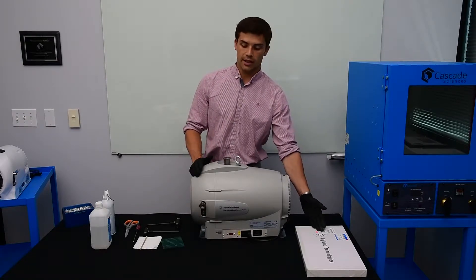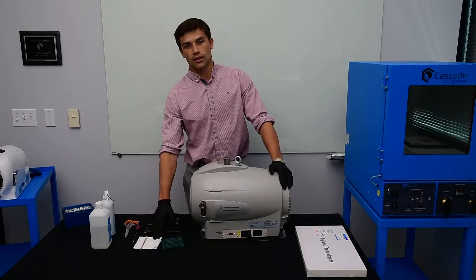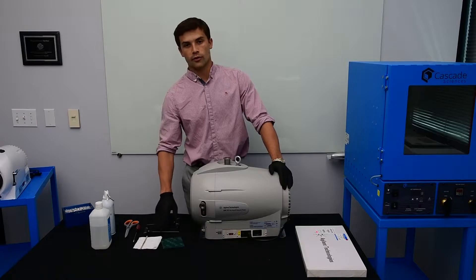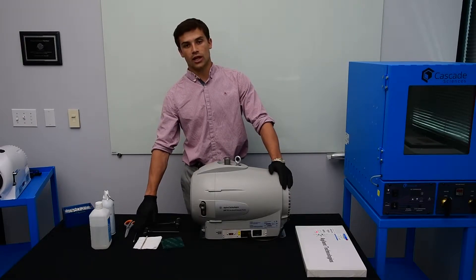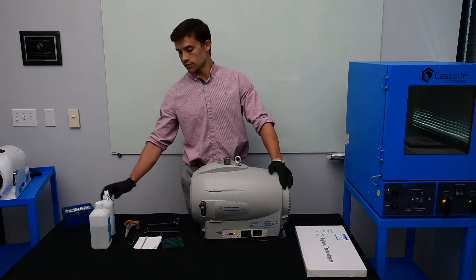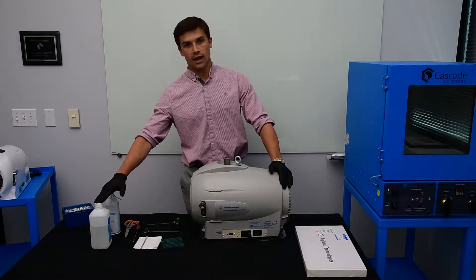In order to get started, you're going to need a new tip seal kit, scotch-brite, a lint-free cloth, wooden dowel, four and five millimeter Allen wrench, a small screwdriver or pick, scissors or cutters, and compressed air in a can or from a hose.